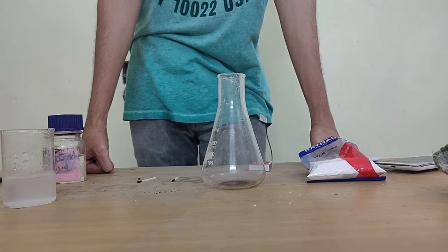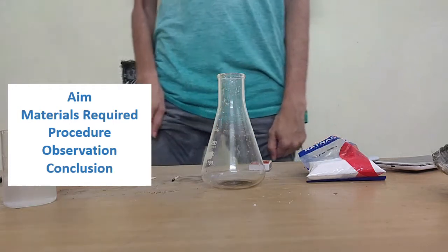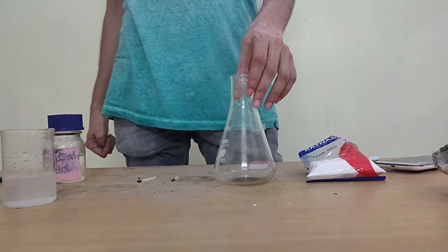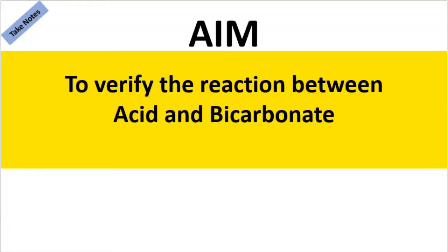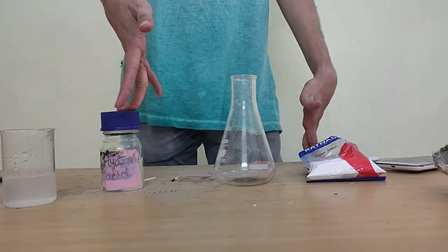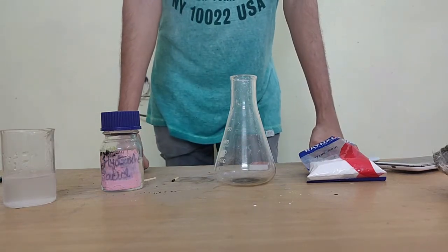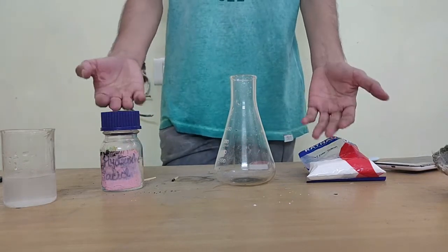And since it is an experiment, again I'll ask you to take your notes down in the experiment format itself. We've already started with the aim of today's class, and that is to observe the reaction between a bicarbonate salt and an acid. Like I told you, the bicarbonate I use is going to be baking soda. The acid we use is the same, HCl, like we've been using for the whole chapter. That is the first two parts of my materials, my reactants.